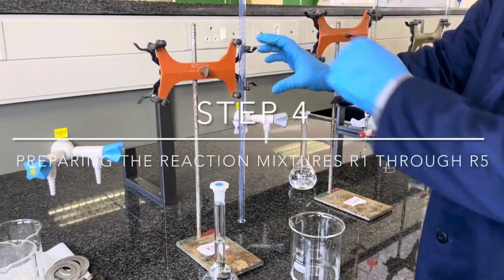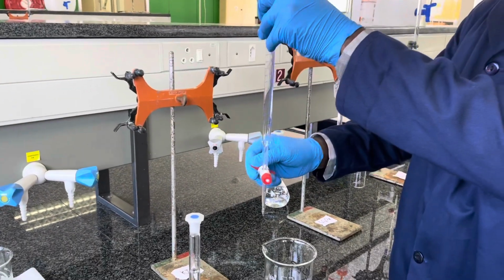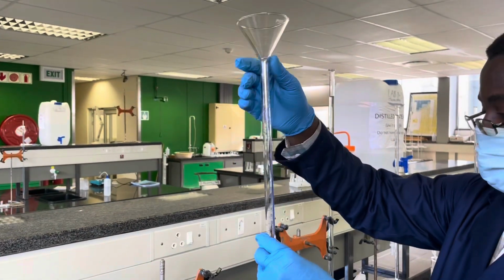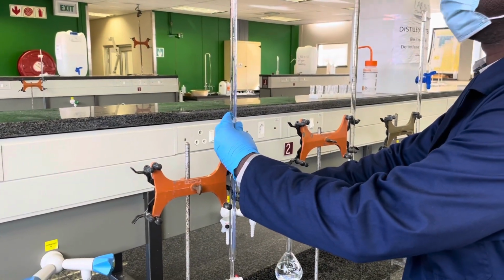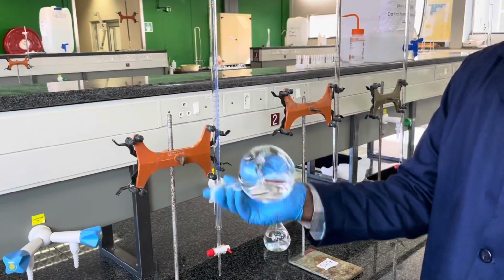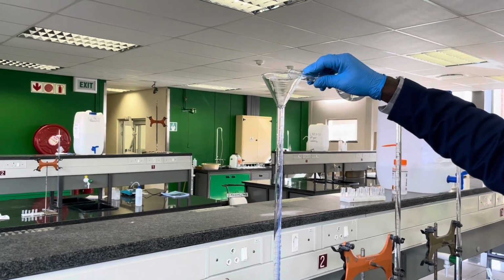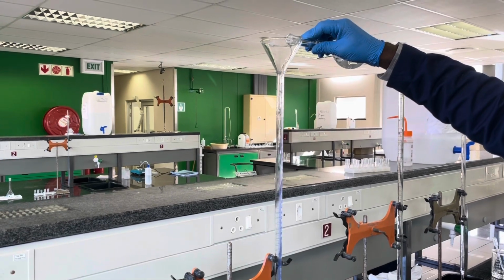Next, we need to dispense our different solutions to form reaction mixtures R1 through R5. To start, we will use the potassium iodide solution as an example. Take a funnel and place it on a Buret as illustrated in the video. Next, take your potassium iodide solution, ensure that it's still homogenized, and then simply add it on top, but do not add more than about 10 milliliters, since you're going to use this to rinse your Buret first.